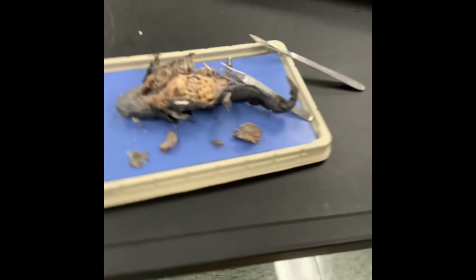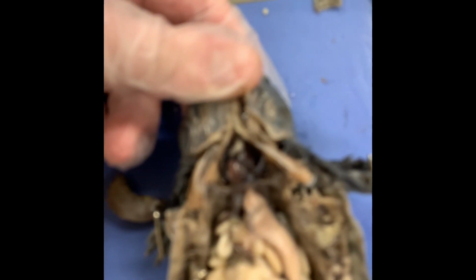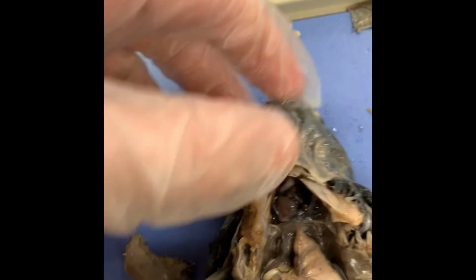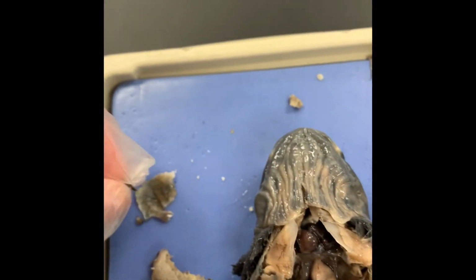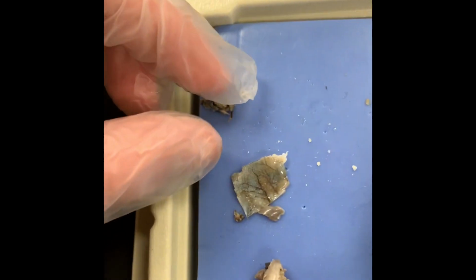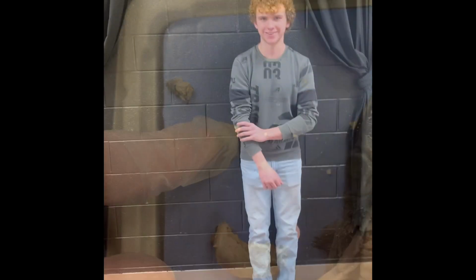Alrighty. If we look a little bit over the stomach, let's see if this will focus. Come on. That's its heart. Salamander's hearts have 3 chambers. You might be able to see that, yeah. See a lot of the different kinds of veins and arteries going through that.